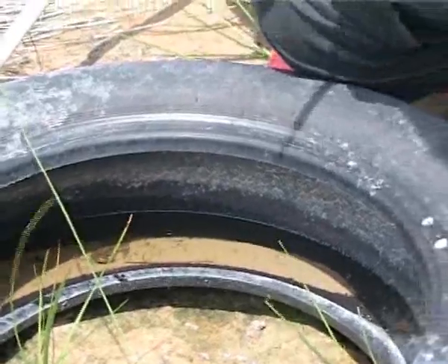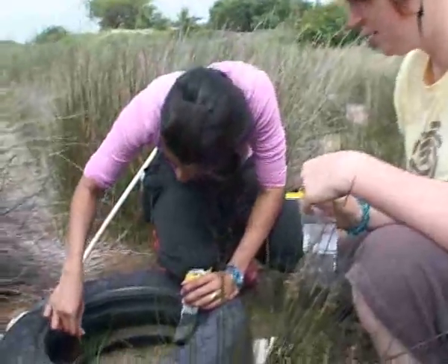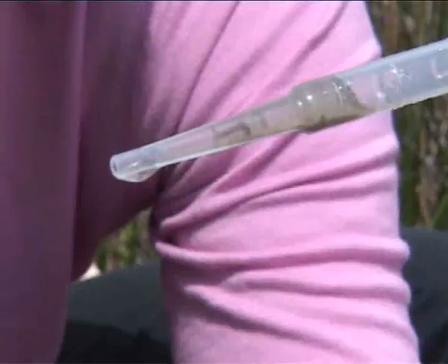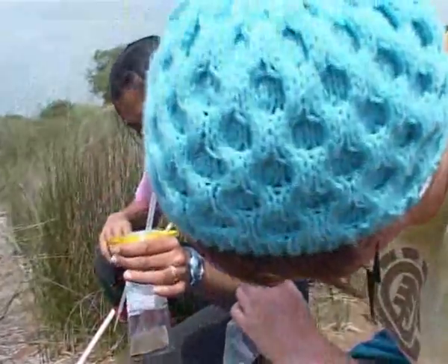There's a lot of mosquitoes in there. So what we're going to do is directly use the pipette. Squeeze it first, aim for your larvae and hope for the best. There you go — look at it! It's right at the tip. There we go. Fantastic. I think I've got quite a few in here now.